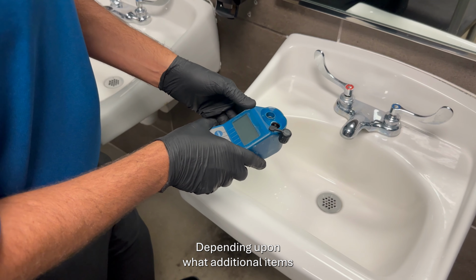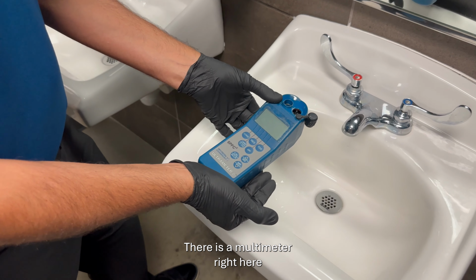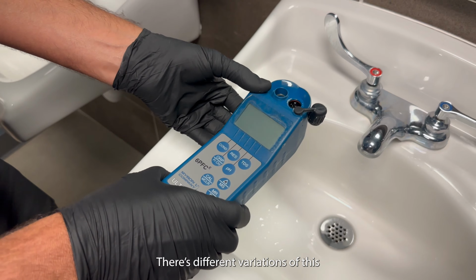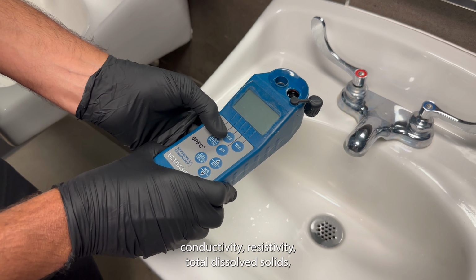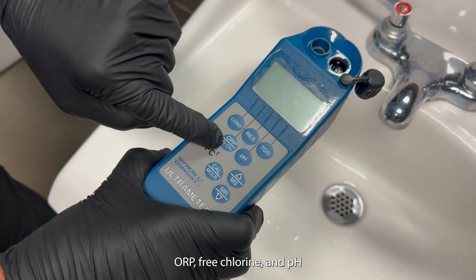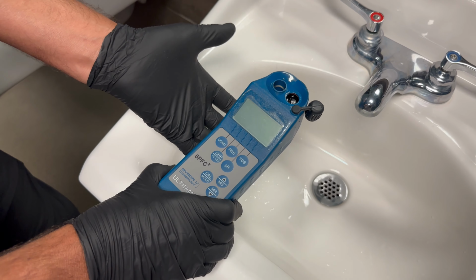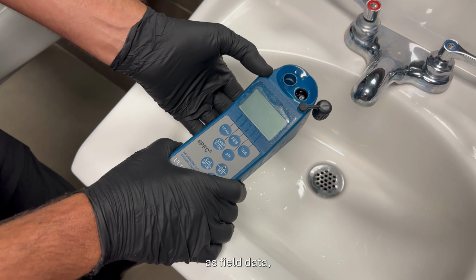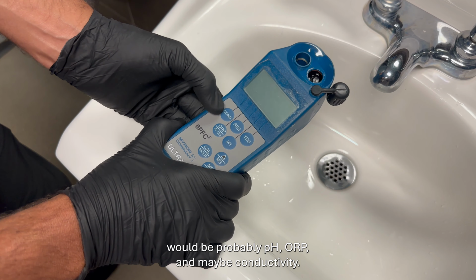Depending upon what additional items you want to measure out in the field, there is a multimeter right here that is a Myron L UltraMeter. There are different variations of this, but with this particular one you can measure conductivity, resistivity, total dissolved solids, ORP, free chlorine, and pH. I'd say the common items that could be read out in the field as field data would probably be pH, ORP, and maybe conductivity.